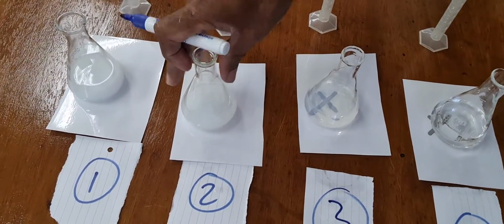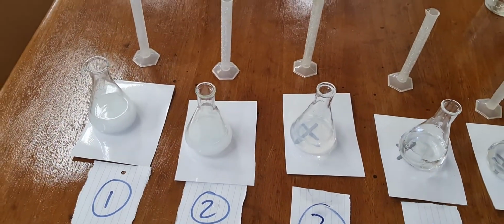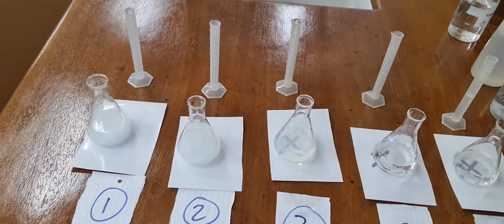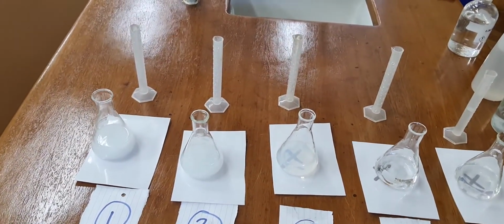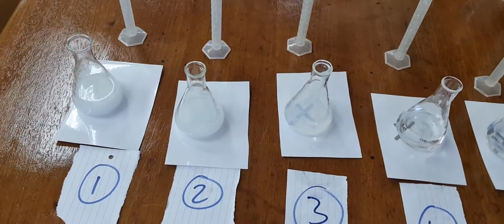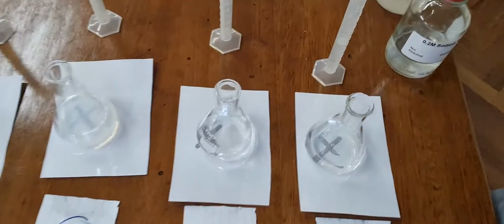Right, this, I can't see the cross now. I cannot see the cross, and therefore I'm losing it now. Is it 1 minute? 1 minute and 40 seconds. And then the third one is happening.